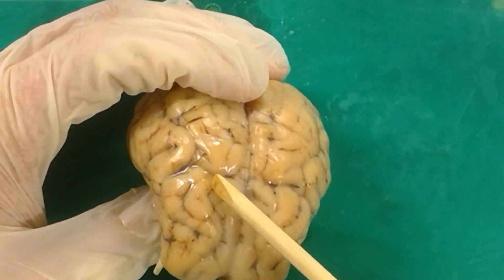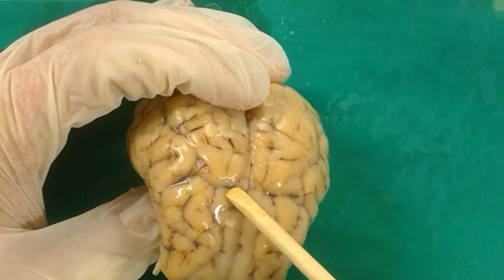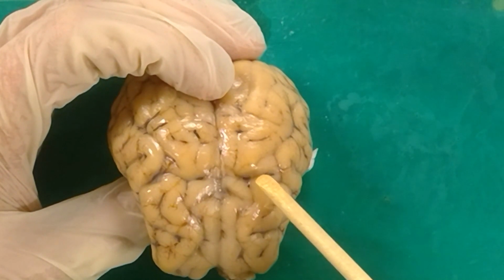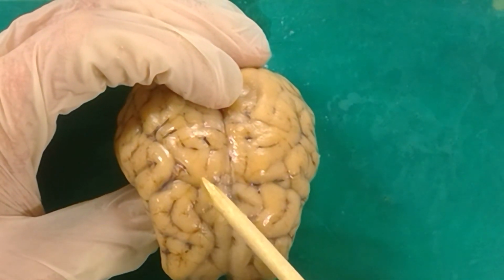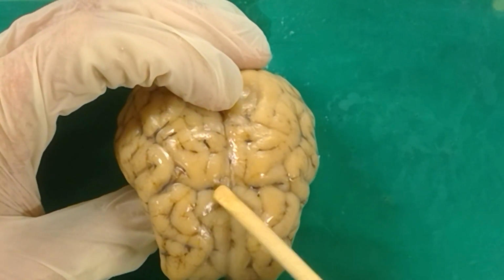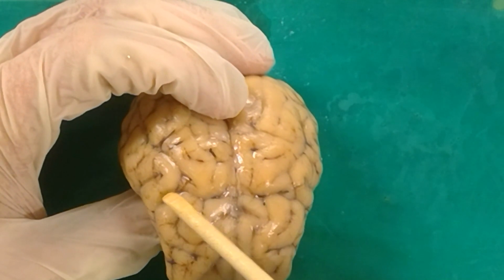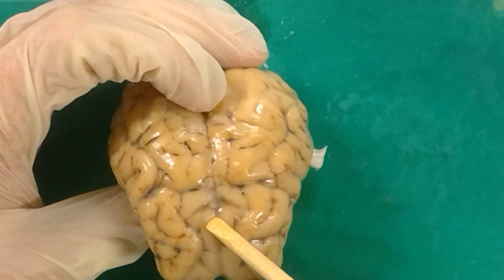It keeps going back until it stops right here at what's actually called a fissure. We've got one on this side and another one right here on this side. Where it stops, it makes a T shape. Here's the bottom part of the T, and there's the top part of the T. This is known as the cruciate fissure. Cruciate like cross, a T's like a cross. That's how I tend to remember it.